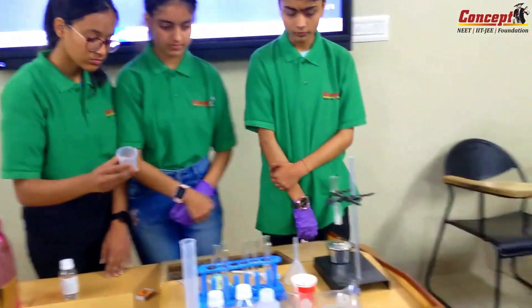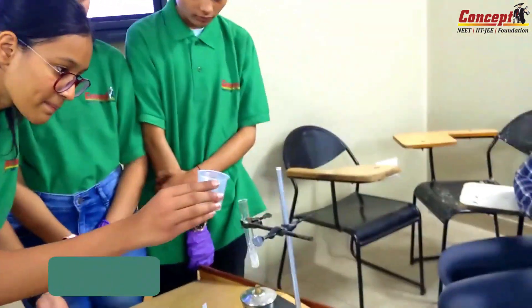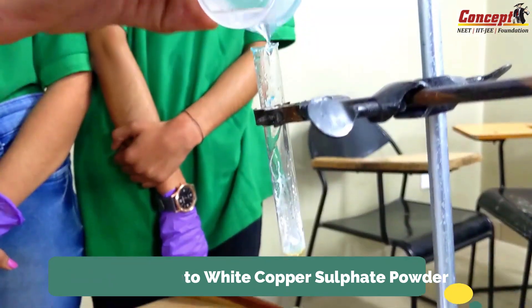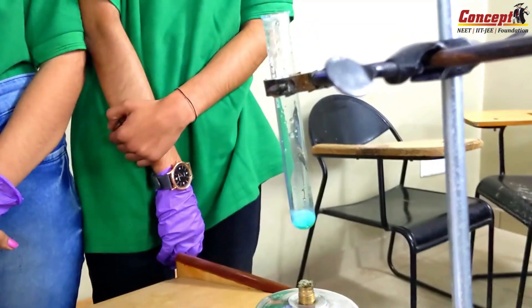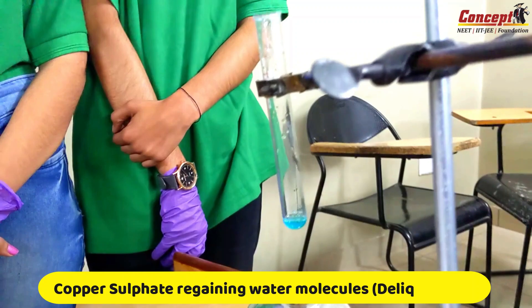Add water to the white powder very slowly. Can everybody see the blue color again?